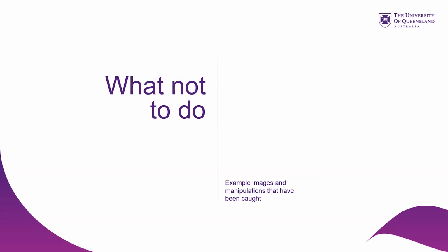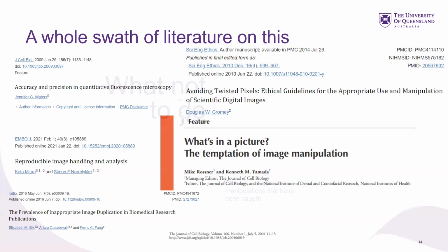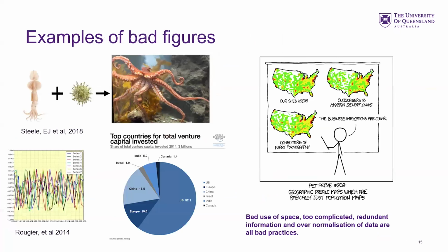Got some slides on what we shouldn't do. Now, again, there is a whole swath of literature on accuracy, reporting, and horrible image analysis pipelines. What's in the picture? This is the famous one from JCB. But here's some examples of bad things. These are all published in different reports and things.